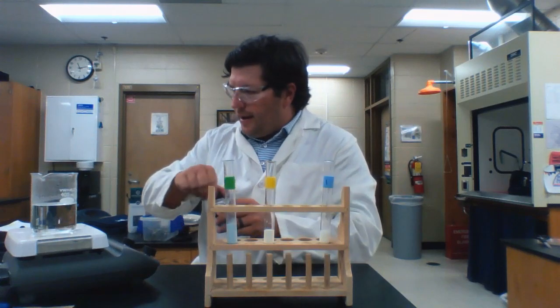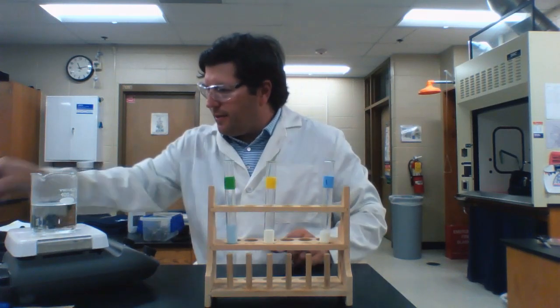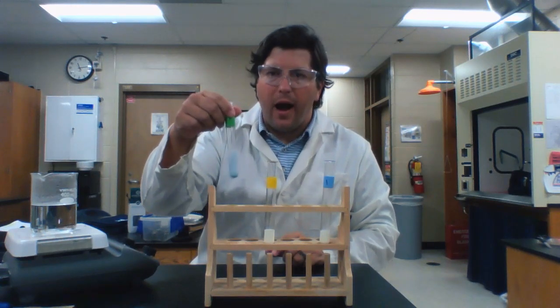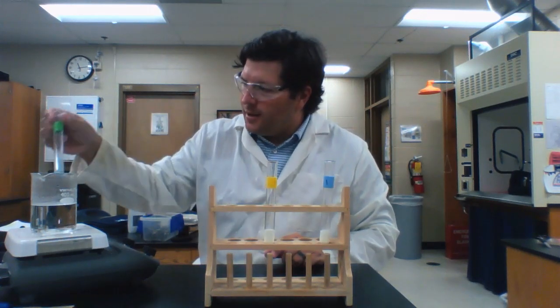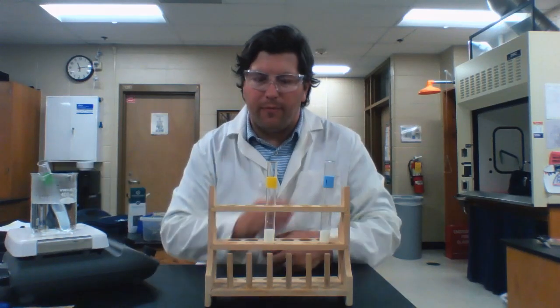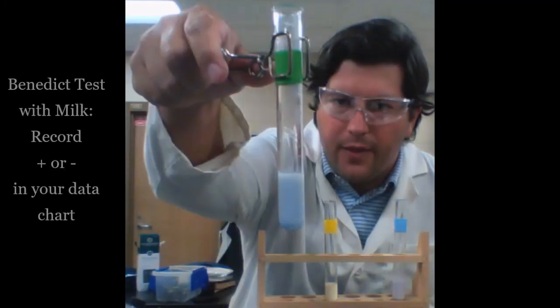All right, and now if I look at my directions, that test tube, after I mix it gently, is going to need to sit in a hot water bath for about 2 minutes. So I'm going to put that over here and let that hang out while I perform my other tests.